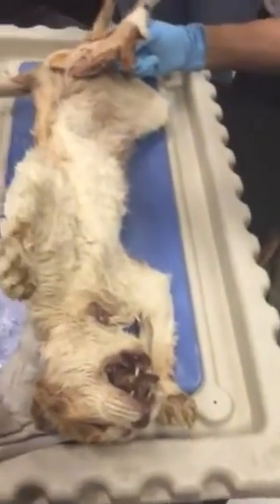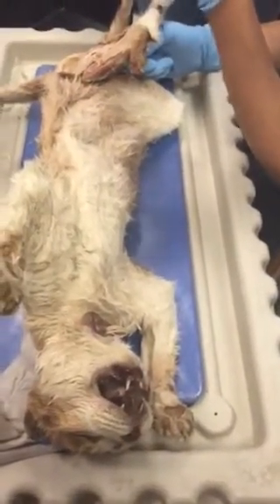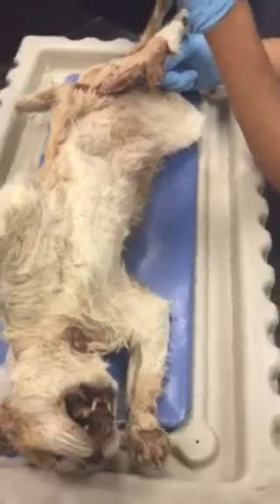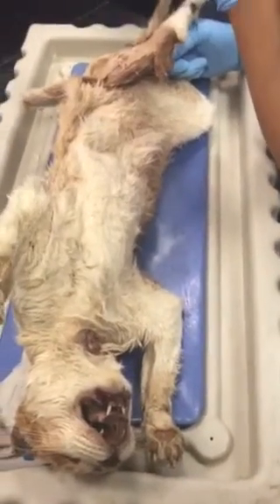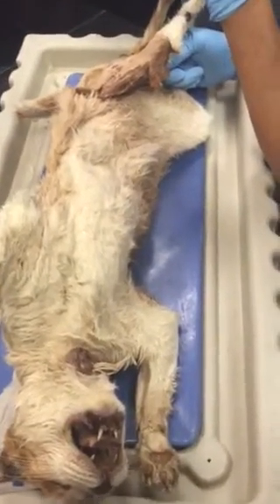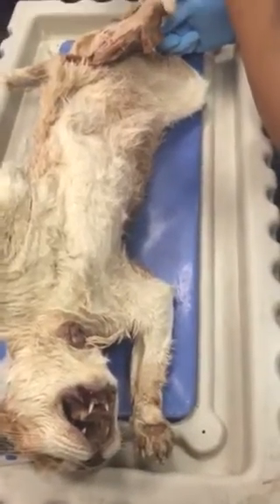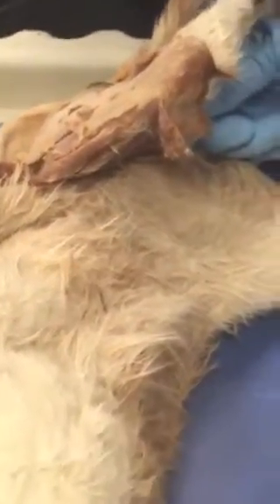Okay, can you turn that leg so that the posterior side is facing? Do you see these two? You have two muscles in the back. One is more lateral. What is that, with the number 2 there? Biceps femoris. And the one medial to that? Immediately medial. Semitendinosus. And then the other one being covered up is semimembranosus. Sometimes I confuse these two, semitendinosus and semimembranosus.